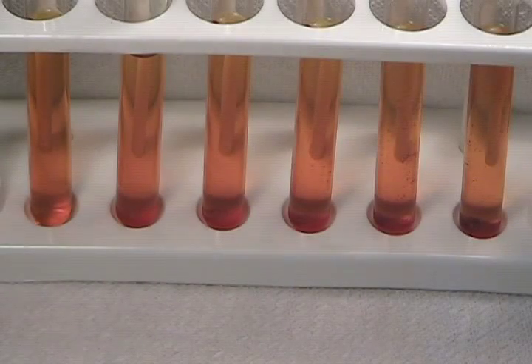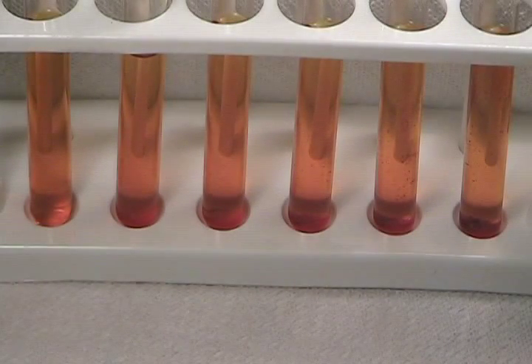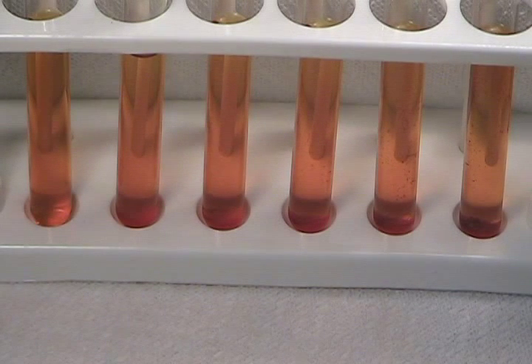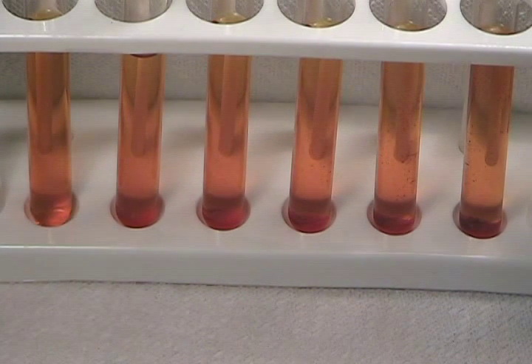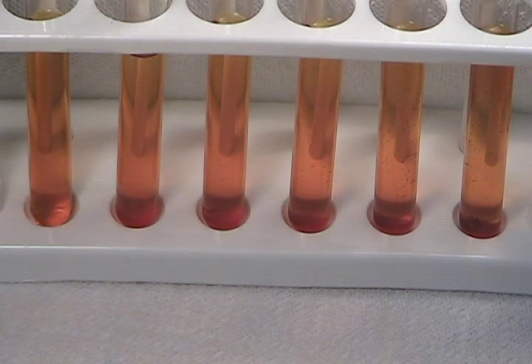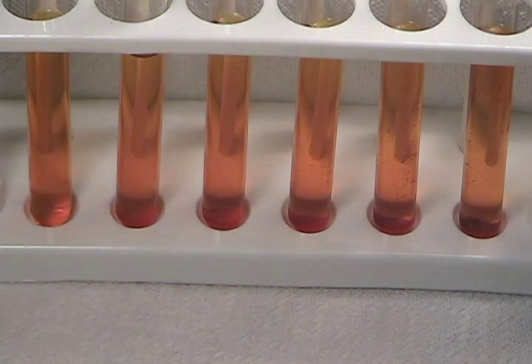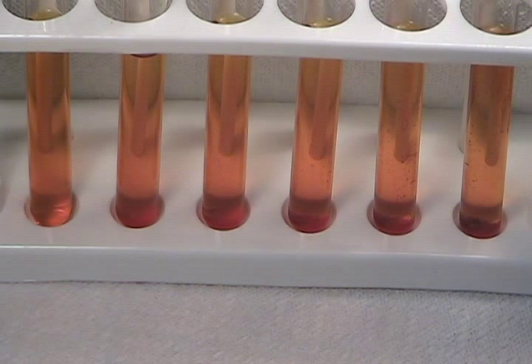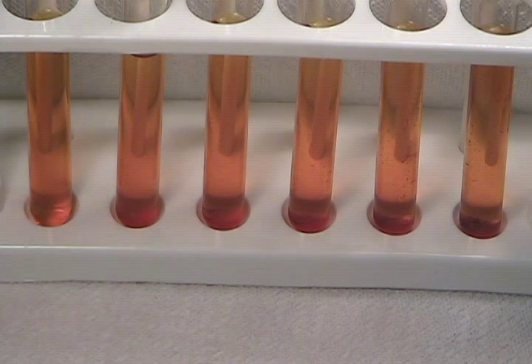This is just a quick follow up to the last video. The test tubes containing various dilutions of quinine alkaloid, treated with Dragendorff reagent, have now been settling for a couple of days. As you can see, the four test tubes on the right, those with the higher concentrations of quinine, all have distinct precipitates.